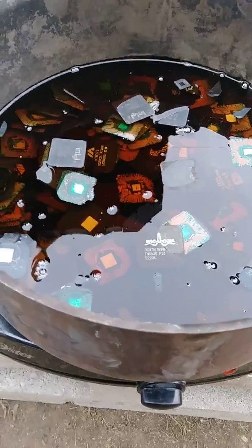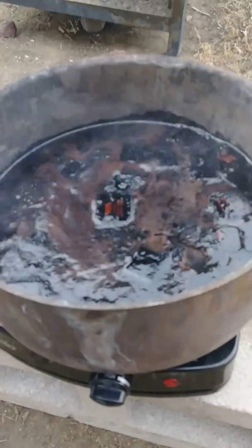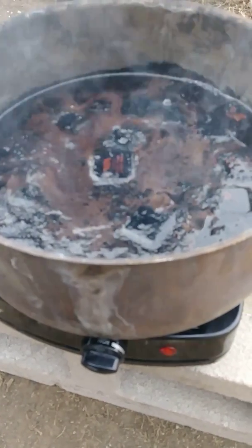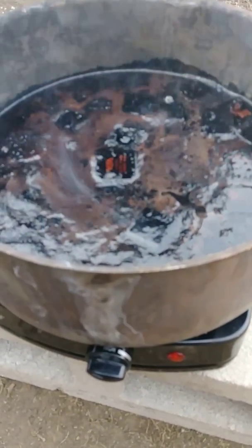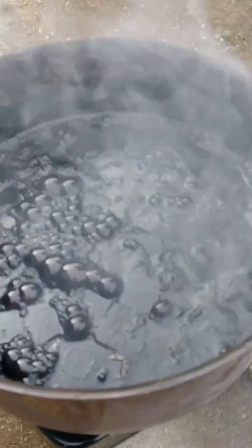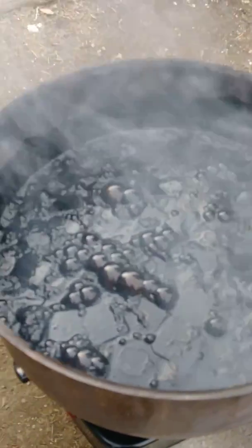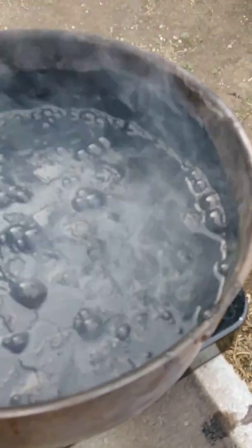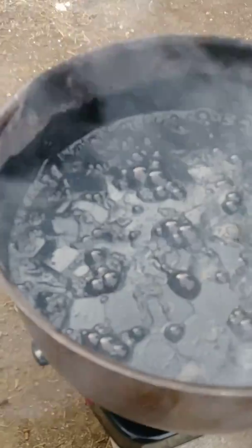So I'll be back. As you can see it's going pretty good now, it's warming up. PPE is on. Not quite there yet but it's getting there. As you see, they're nearing completion — it's a very good boil.